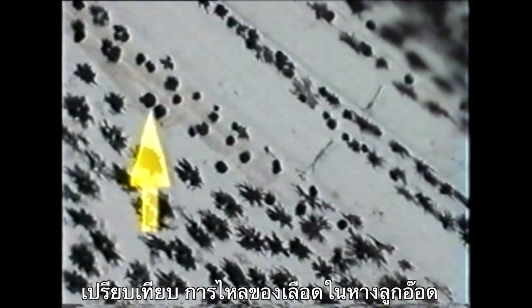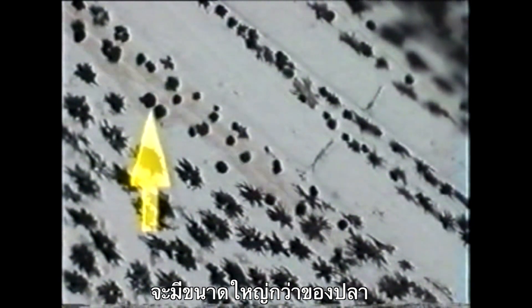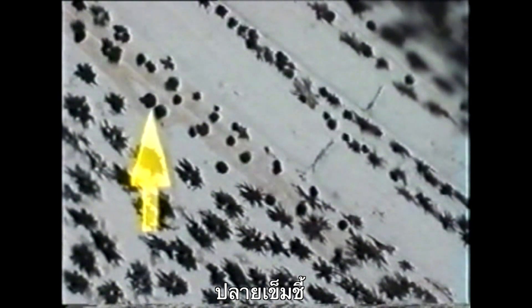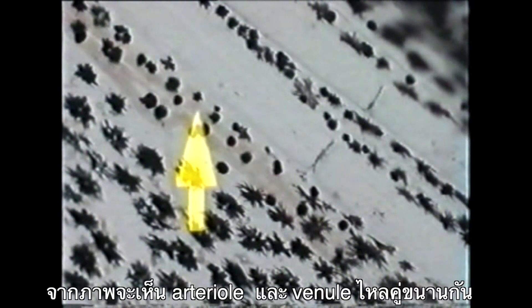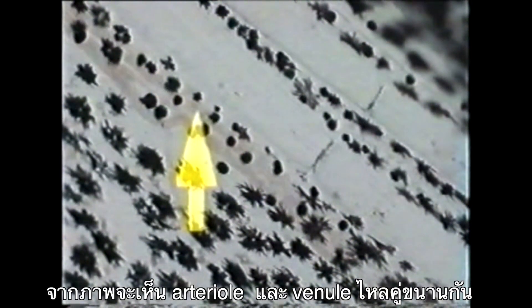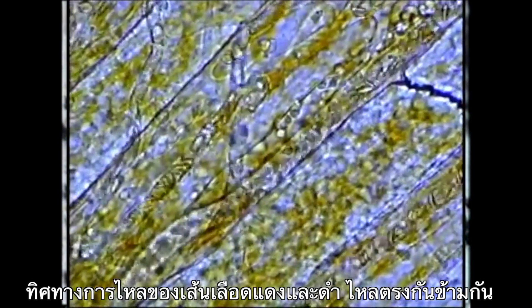For comparison, let's look at the blood circulation in a tadpole. The red blood cells of the tadpole are larger than those of the fish. These are the arteries. Notice the branching of the arteries. Here we can see an arteriole and venule positioned in parallel. The direction of the blood flow is opposite in these two vessels.